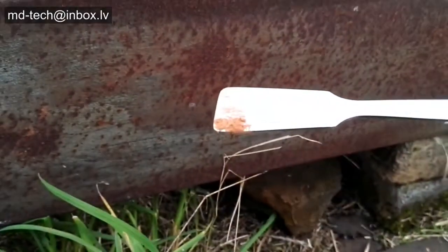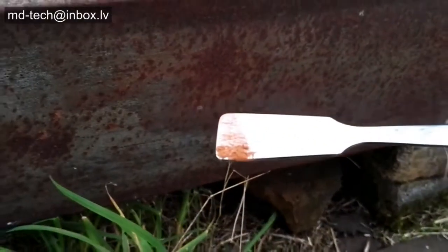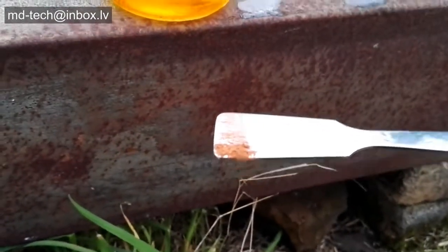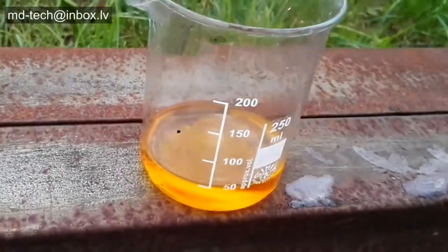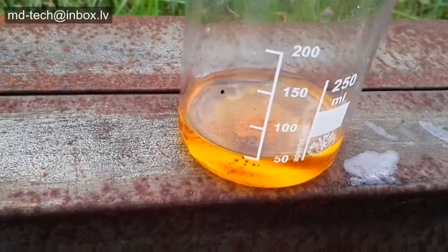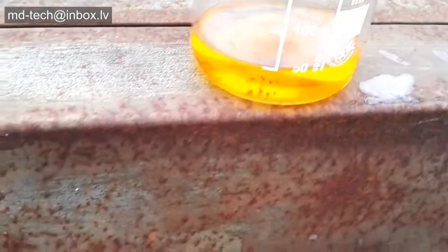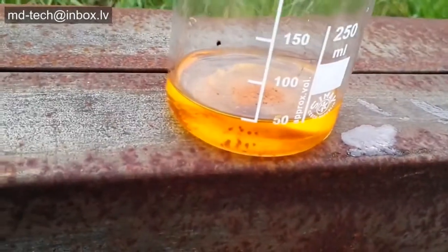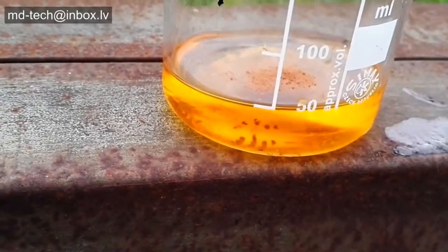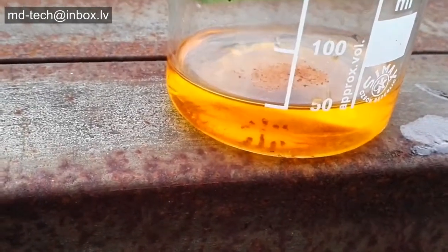I use pure gold powder to demonstrate the gold reaction with bromine solution. Gold in bromine solution dissolves according to electrochemical, chemical — EC — mechanisms.